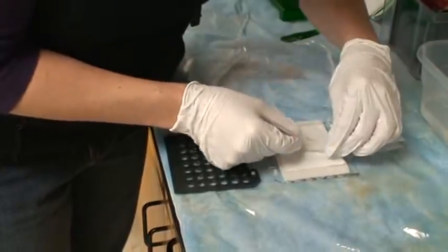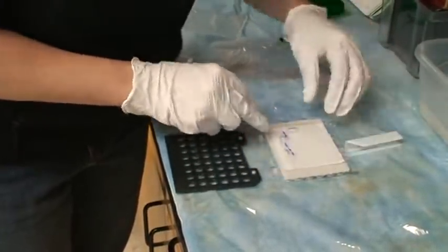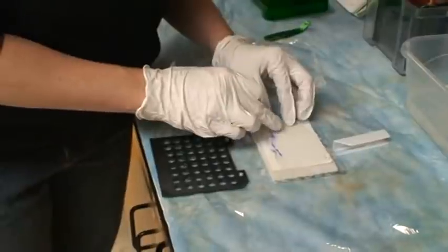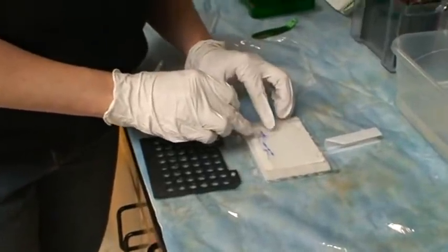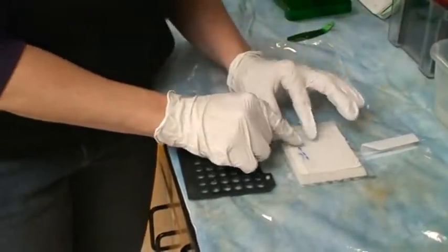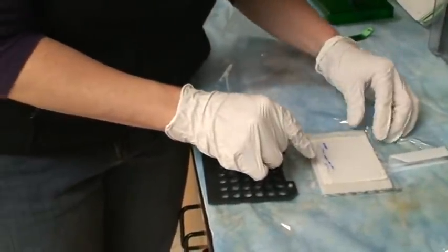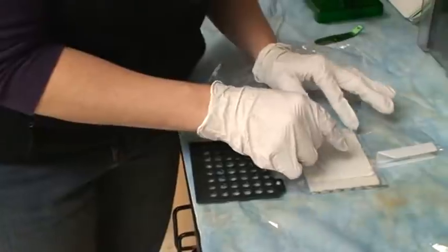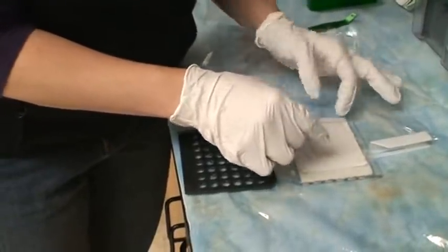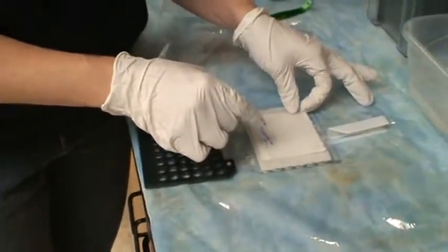Let's see what I can do to fix it. I'm going to lay that down on the membrane, and then I'm going to try to get this little rip fixed. Martin, you can hit pause while I try to fix this.